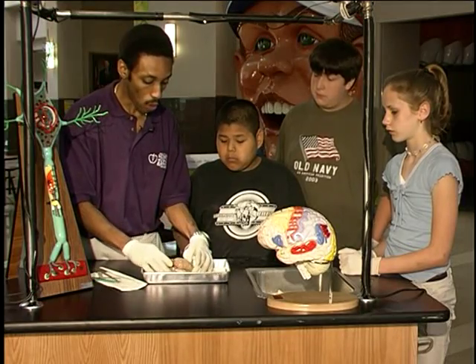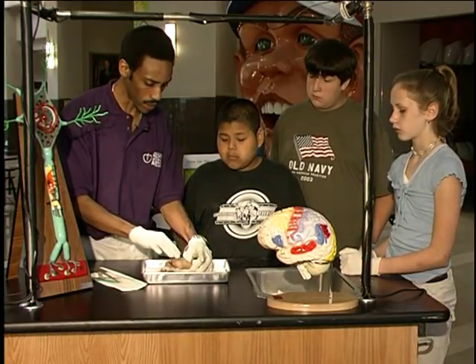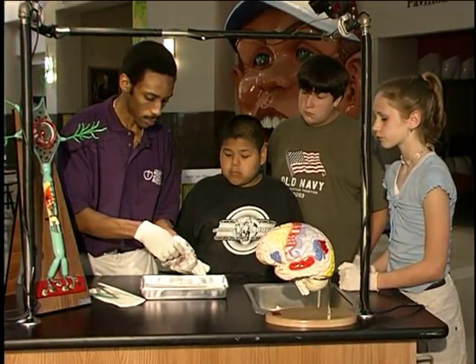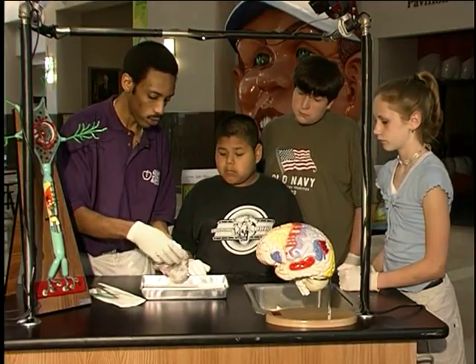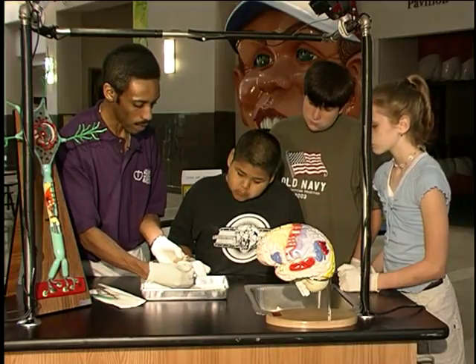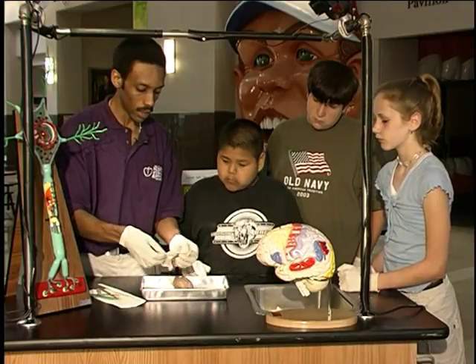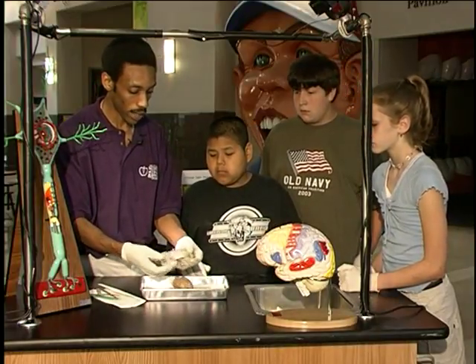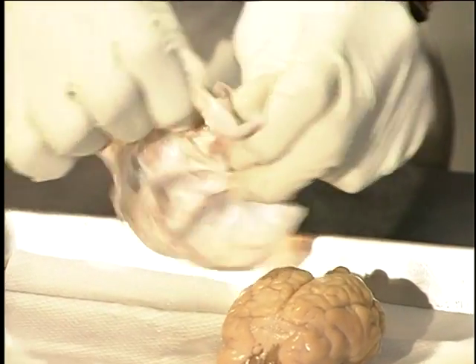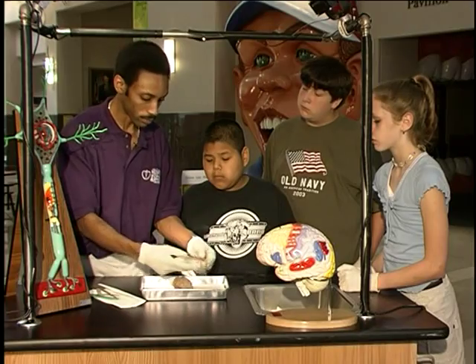Now, we haven't removed all of the layers of the meninges, simply the Dura Mater. The other two layers are still attached to the brain itself. We'll remove the Dura Mater completely, and as we remove the Dura Mater, you'll notice that some of the 12 cranial nerves actually begin to tear off of the brain and spinal cord. Now, the Dura Mater translates into the tough mother. Take a look at how strong the Dura Mater is. And it's designed to keep germs off of the brain.